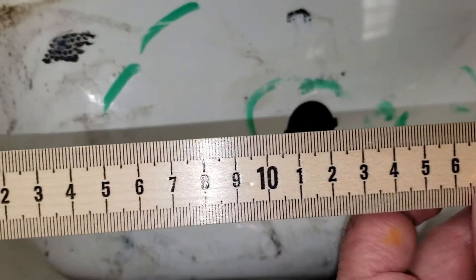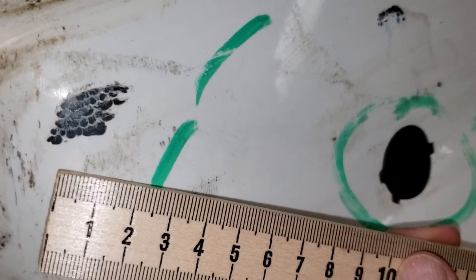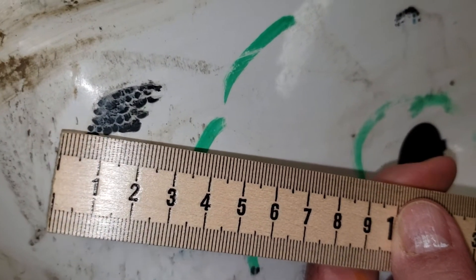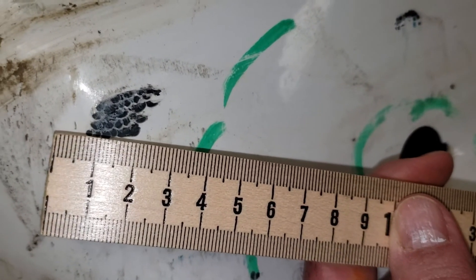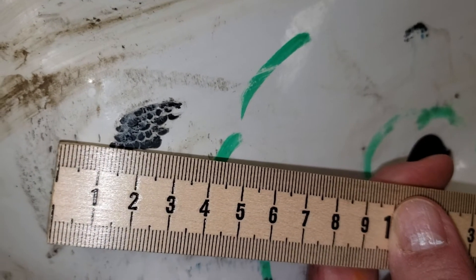If we go over and look at these multiple impact sites, these are measured in millimeters — one or two millimeters, three millimeters possibly. Here's a different color of impact. Tell me about the directions, and tell me about any stripes or markings that you see.